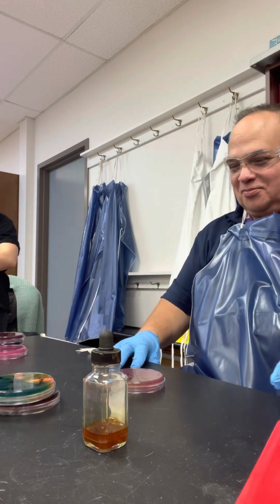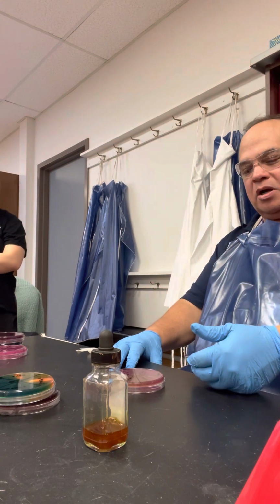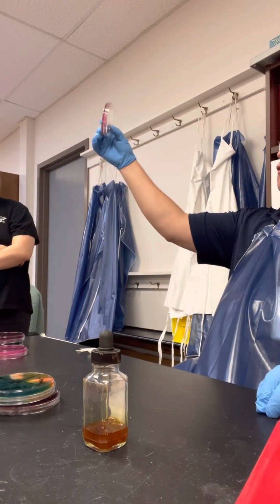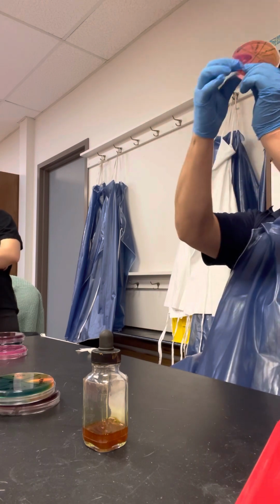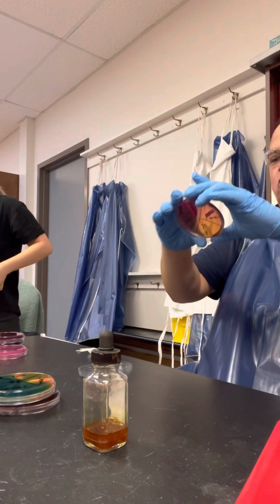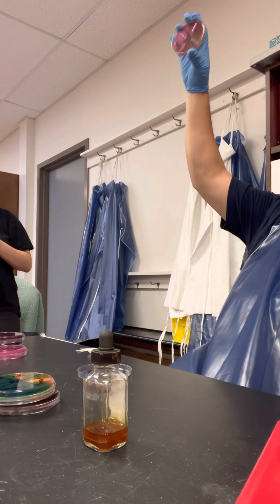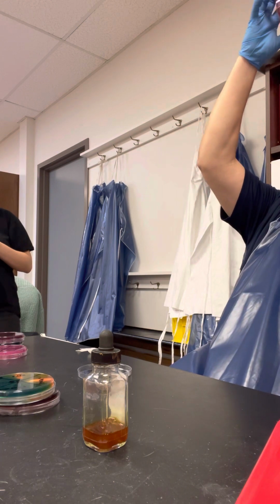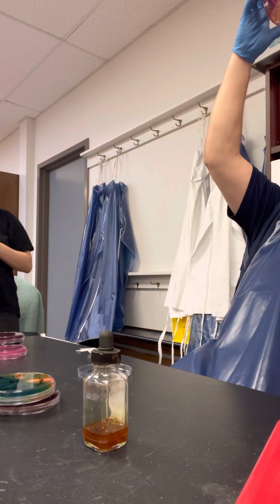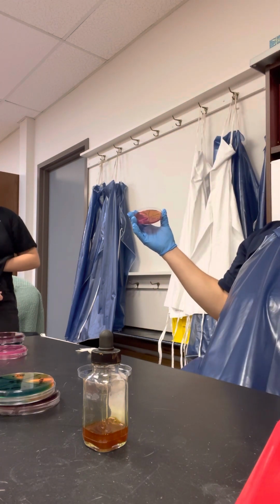Okay. So we move now to the last one, which is MacConkey. And MacConkey is the easiest plate to look at. First of all, look at the different colors that happen on MacConkey, and look at the reactions that are occurring. It's quite beautiful. So here you have two organisms, these two, that are lactose positive. And they're lactose positive because they produce these really brilliant red, pinkish colonies, yes? And that's because they have neutral red. Neutral red is a pH indicator.